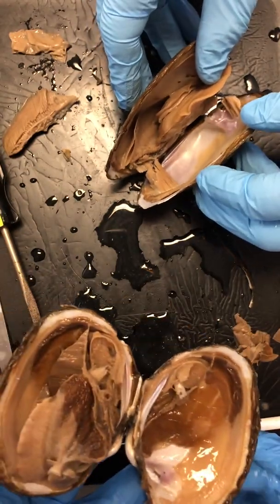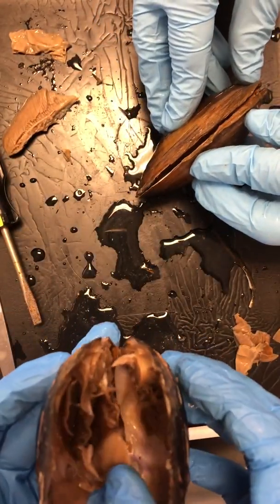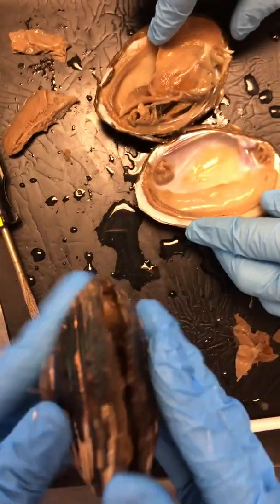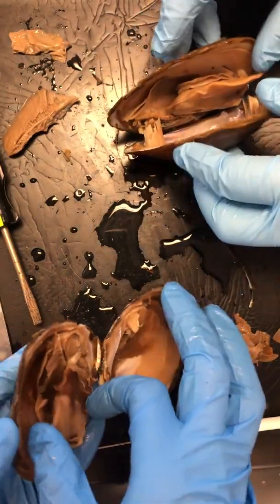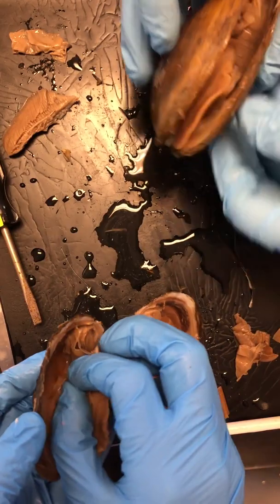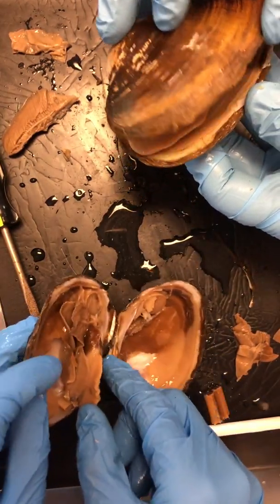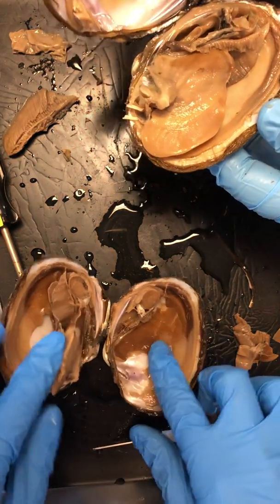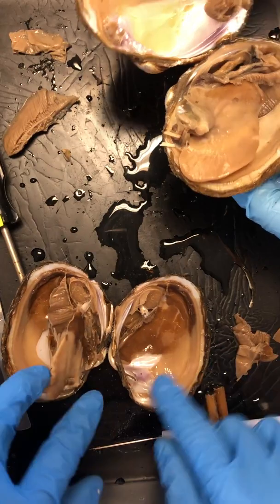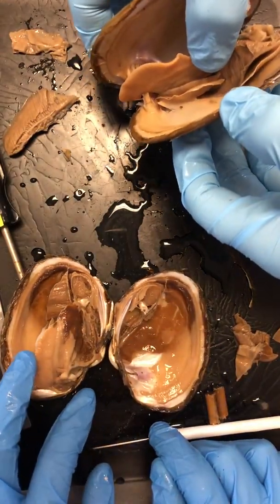Are they kind of like the same on both sides? They are. In fact, they have what we're going to call bilateral symmetry, right? So you take this guy and you could split him right down the middle. We've got the same thing on either end. In fact, most of the animals that we've talked about have just been bilaterally symmetrical on their external features. These guys are actually bilaterally symmetrical on their inside too, right? They've got gills on either side, a mantle on either side of their shell, and that foot kind of right in the middle. Two muscles on either side. There's some pretty fancy stuff.